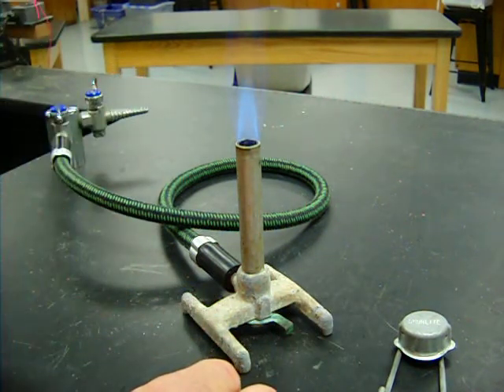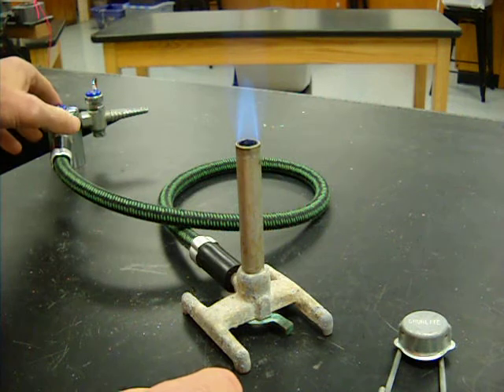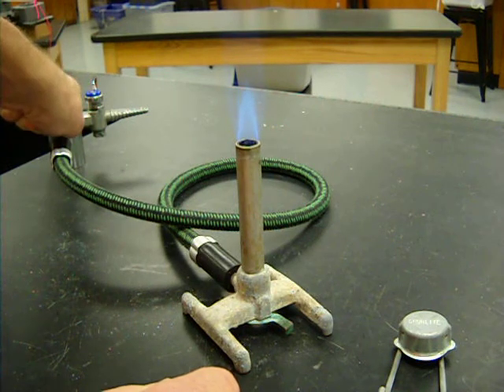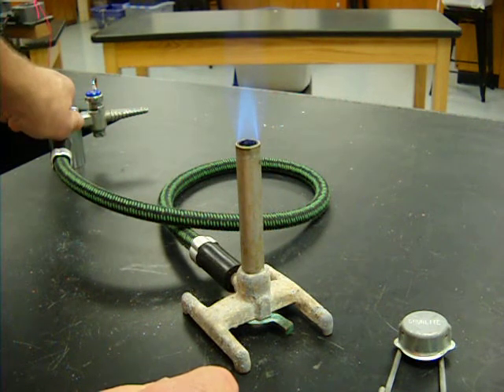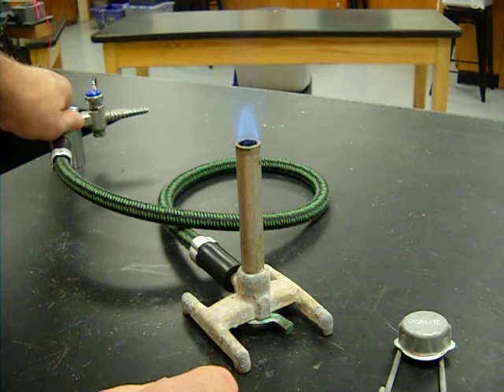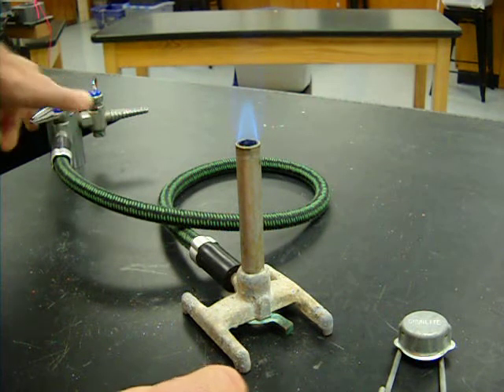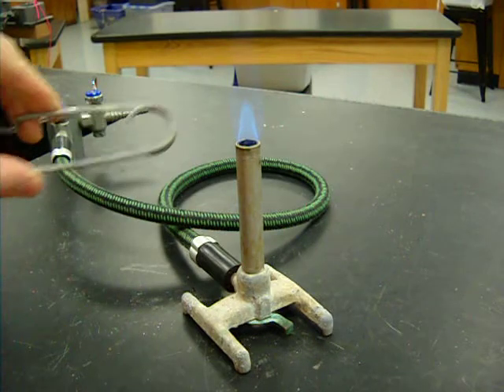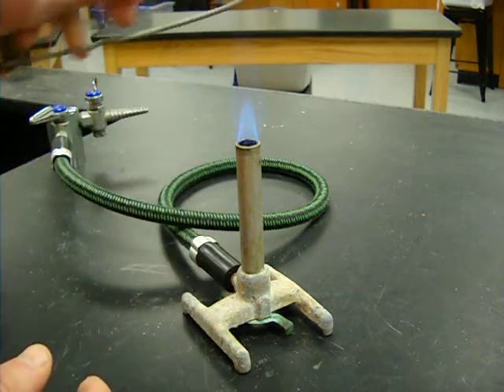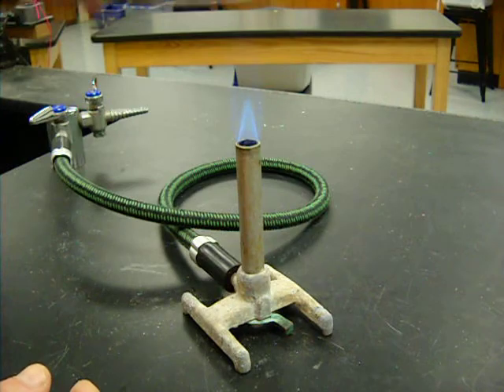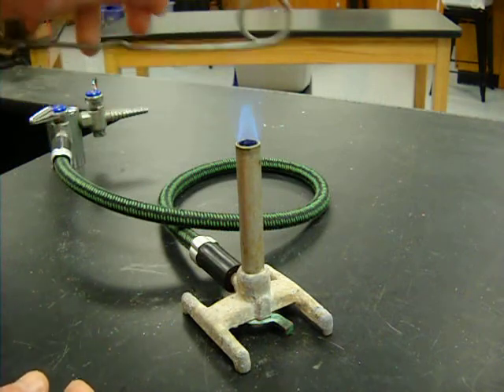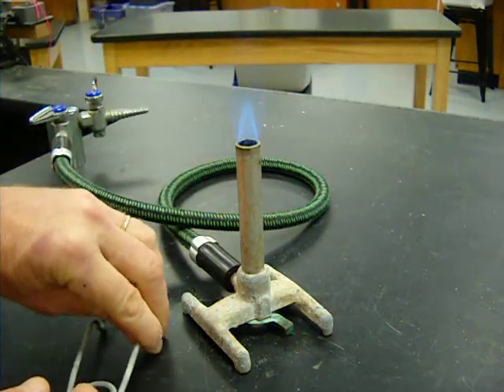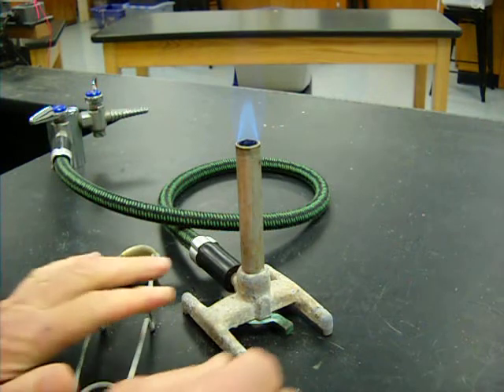I hear it's too turbulent. The flame's a little bit too aggressive. I'm going to back off on my gas a little bit to calm it down. Now I have right about where I want my flame to be. Nice cone. Notice the flame around it or above it is almost invisible. Don't stick your hand there. It will get burned. We could use this flame in our lab.